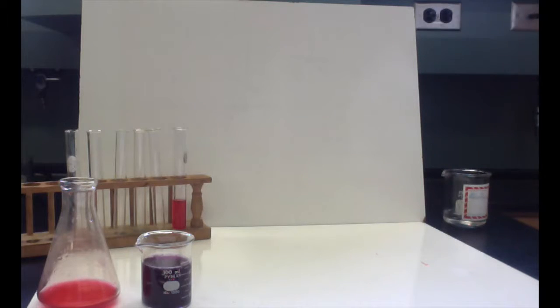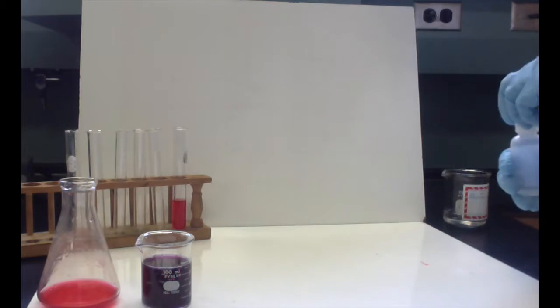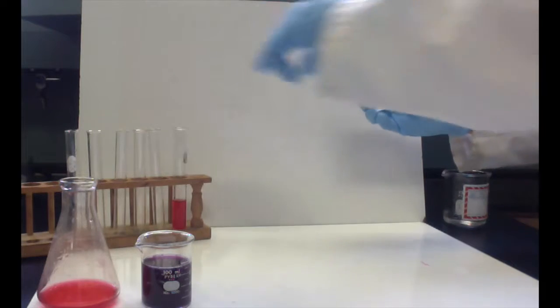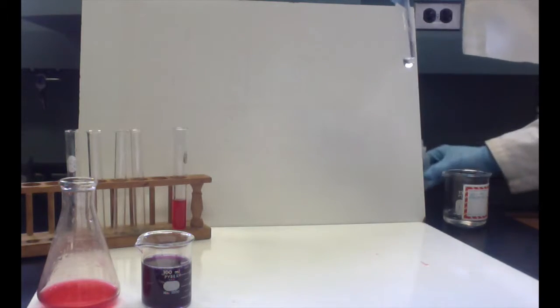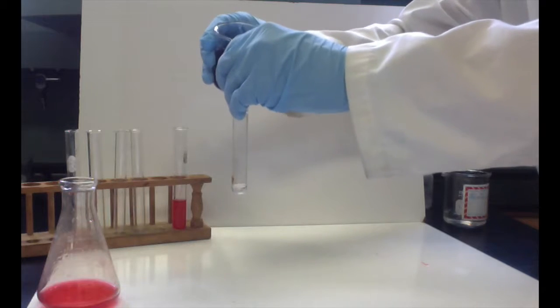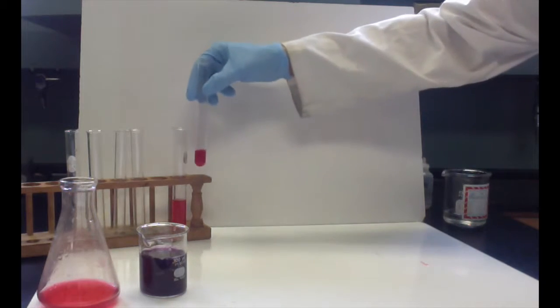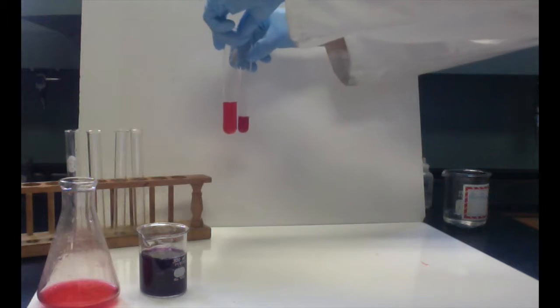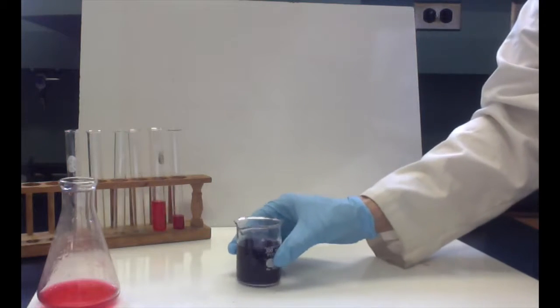Now I'm actually going to try one that's a little bit stronger. That is hydrochloric acid at a one molar concentration, so one mole per liter. And here's the same concentration of sulfuric acid, which is H2SO4, which has two protons to give away. I'm just going to put a little bit of that in here. This is very strong stuff, stronger than hydrochloric acid, and I'm going to put a little bit of water here. Very bright red from this very purple colored liquid.